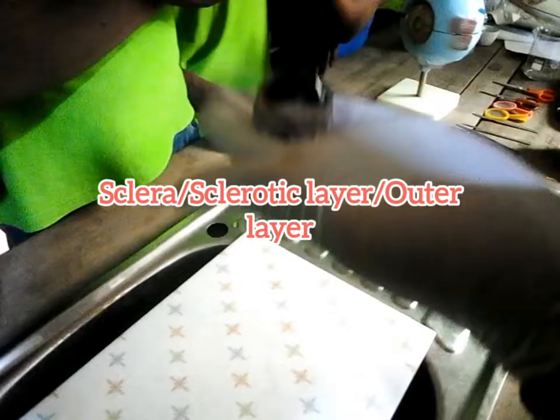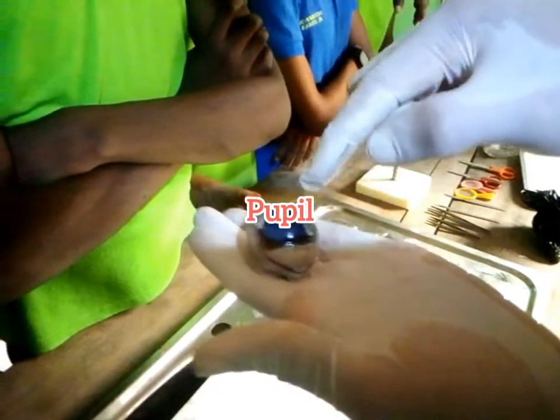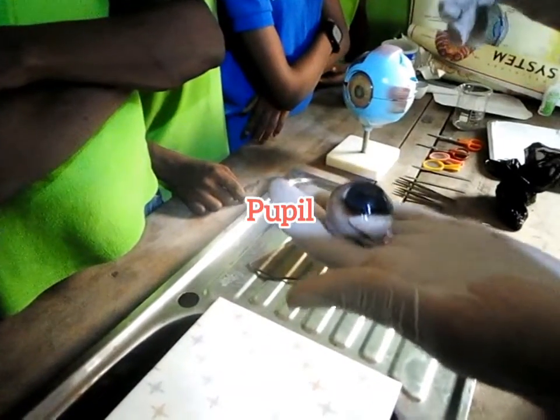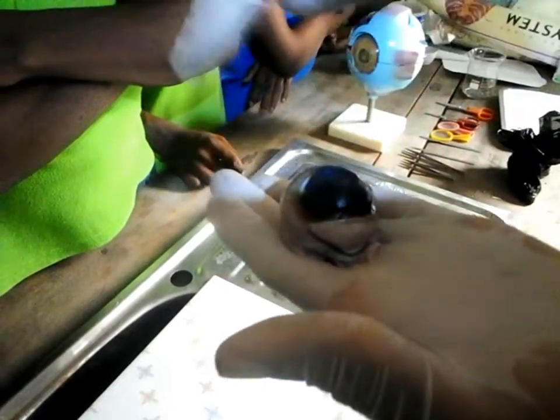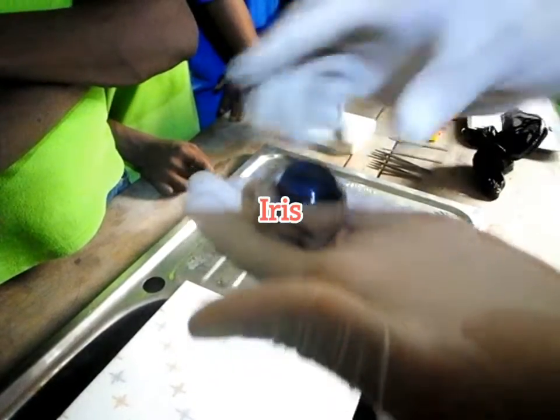Now, if you look at this eye here, you can see the pupil. Are you getting me? The pupil is a little bit bigger than that of humans. Are you getting me? Now around this region, you see this area is darker. Are you getting me? And I believe that's where the iris is. Do you get that? Okay. Now we have the cornea.